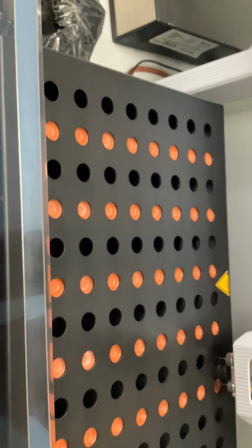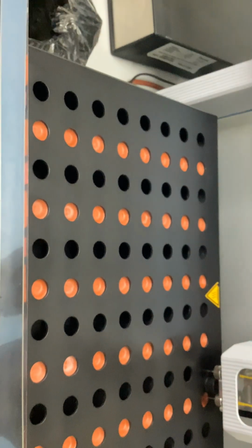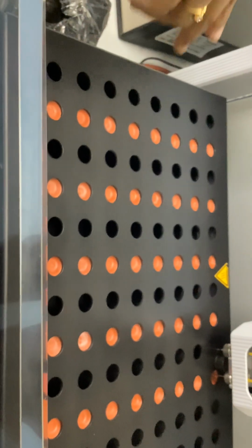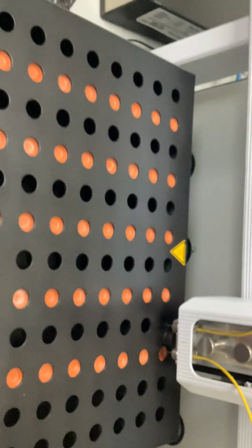There would be some exchange, so we make sure that we are not at any loss. So we keep 2 rows empty, and in the middle we place our tubes.